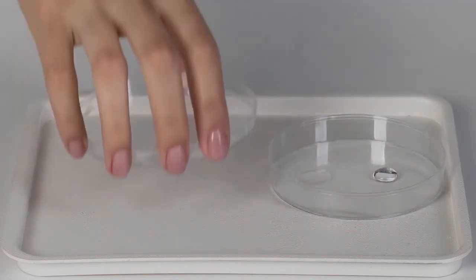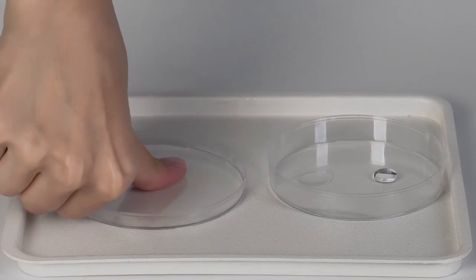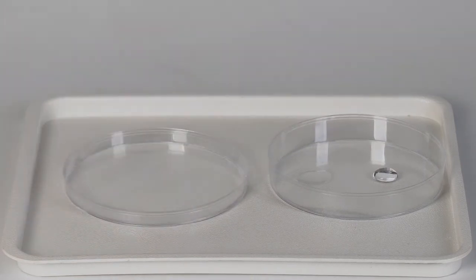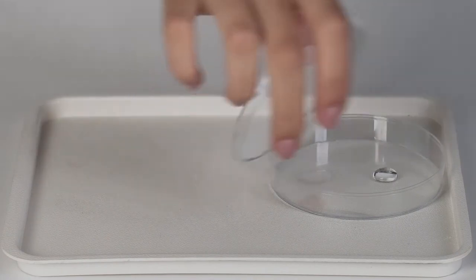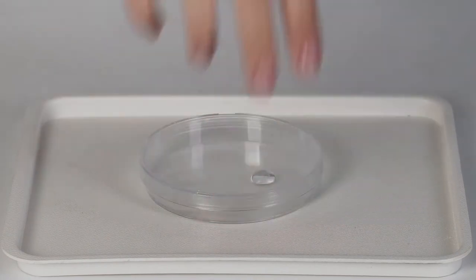Take off one of the protective gloves. Take the Petri dish cover and leave a fingerprint on the inner side. Place the cover onto the Petri dish and wait for five minutes.